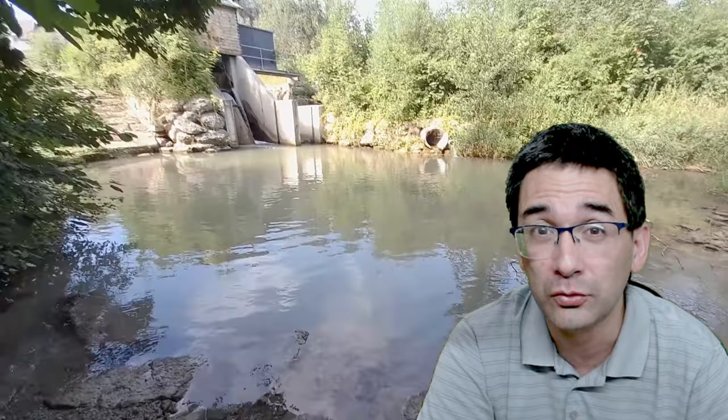I collected the sample from this little river over here. You see the water is a little bit muddy because there was some kind of movement going on and disturbed the mud on the ground. So I decided I have to go to a different place to collect something a little bit more interesting. Usually you find a lot of life growing in the moss or algae that can be found growing on the rocks here.